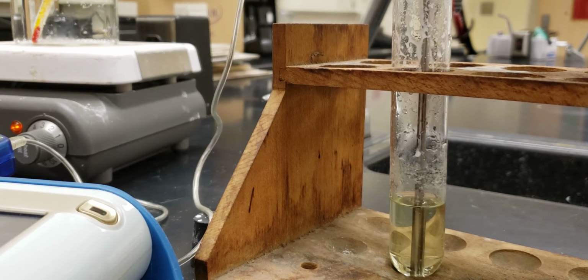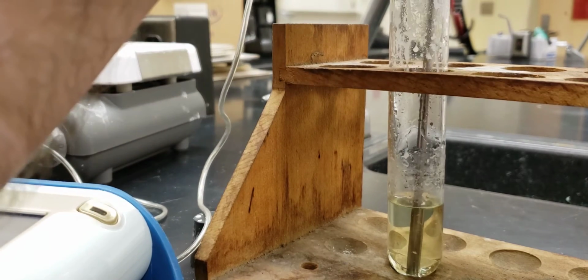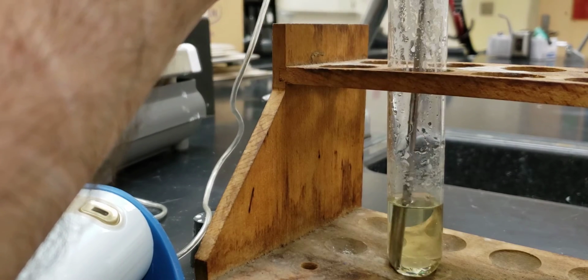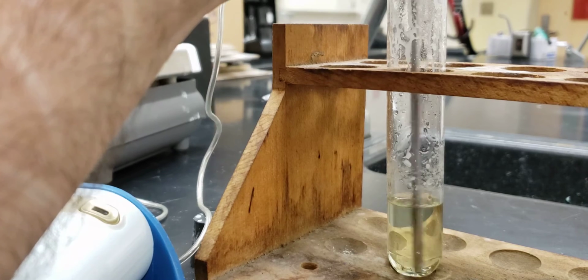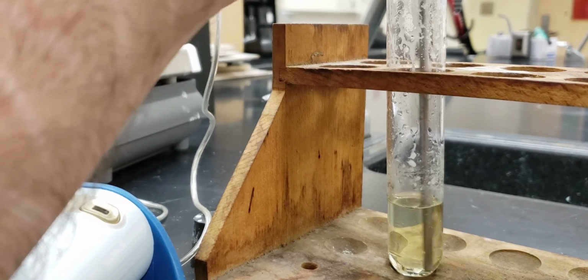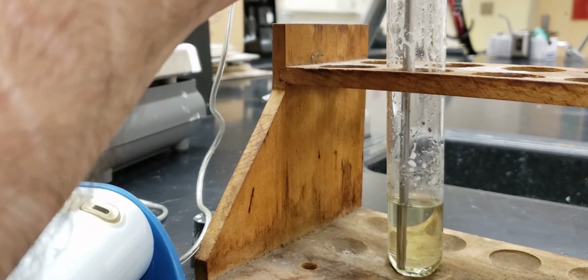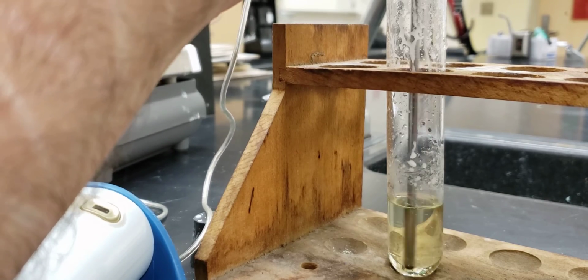Now, at this point, we have a liquid that is cooling. So you should think, okay, in our heating and cooling curve, what part of the graph would that be like? Is this going to be a flat part or is it going to be a diagonal part? Okay. And this just keeps going and going and going.